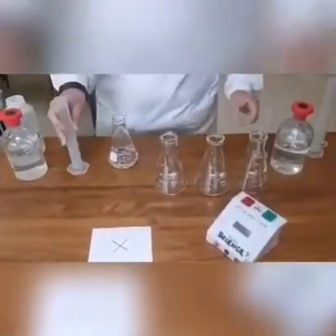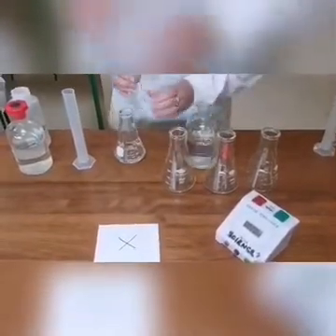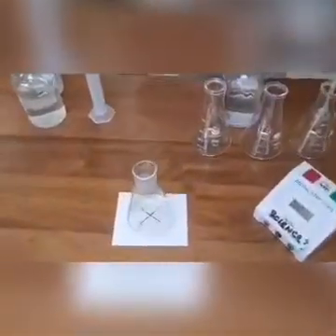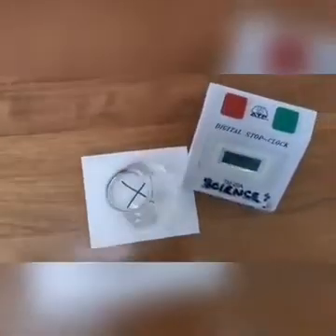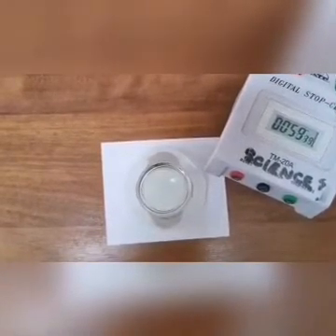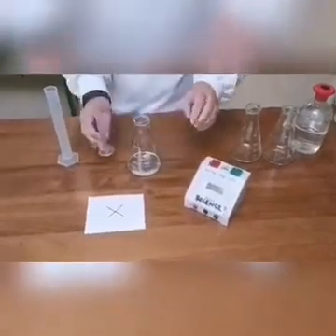This experiment can be repeated by varying the concentration of sodium thiosulfate. We repeated this with 30 cm³ of sodium thiosulfate and 20 cm³ of water. This gave a concentration of 24 grams per dm³. We also repeated it with 50 cm³ of the sodium thiosulfate alone, a concentration of 40 grams per dm³.